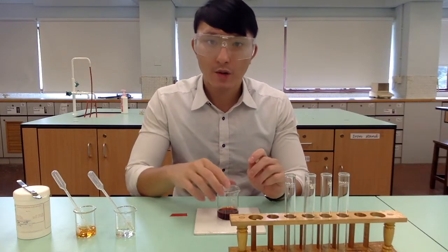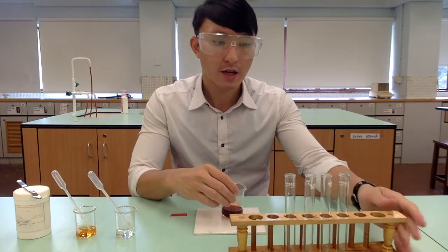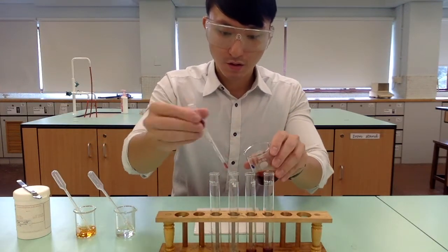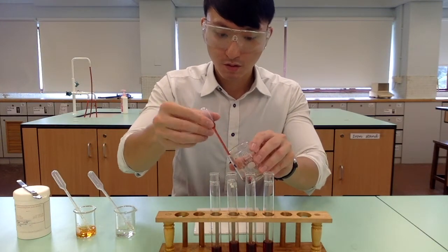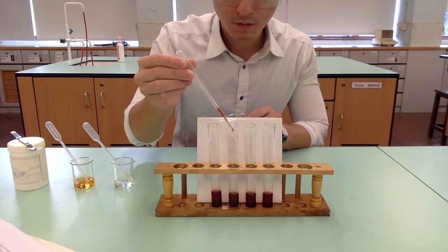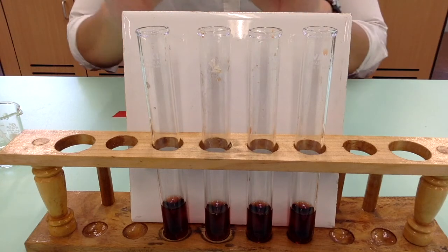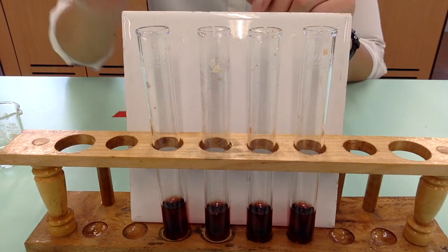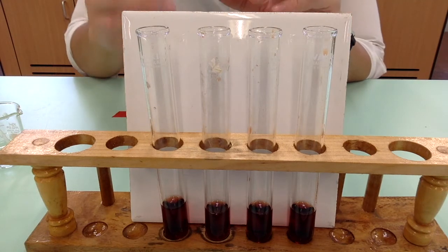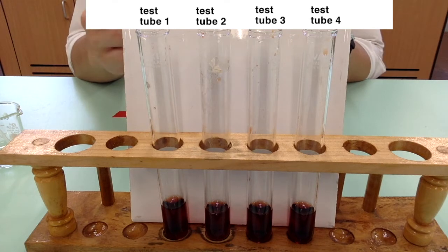Now, we are going to divide this equilibrium mixture into four equal proportions into four test tubes. We are going to add different chemical species into the equilibrium mixture and see how the addition of chemical species affects the color of the equilibrium mixture.